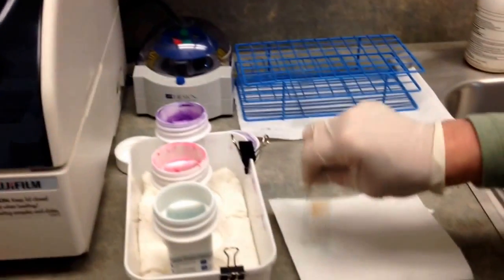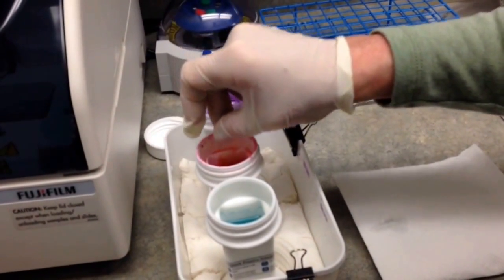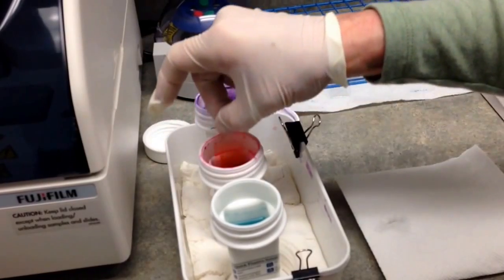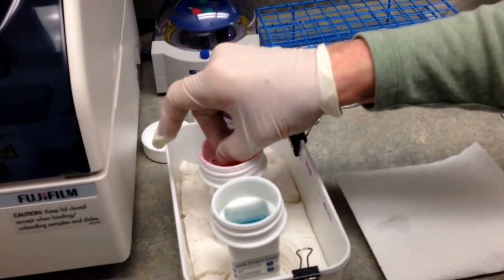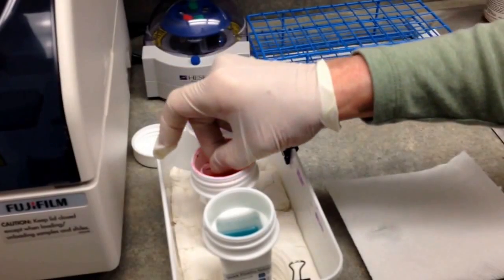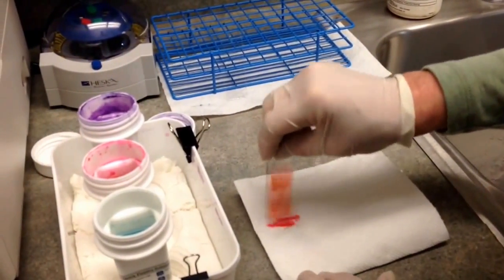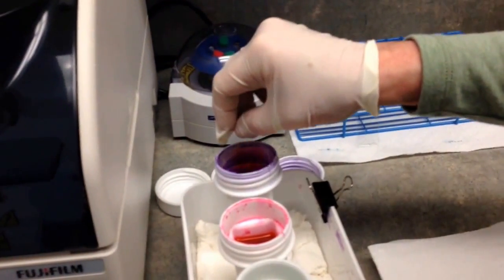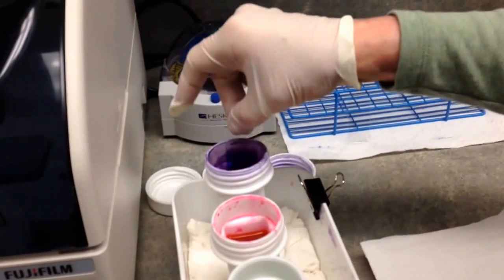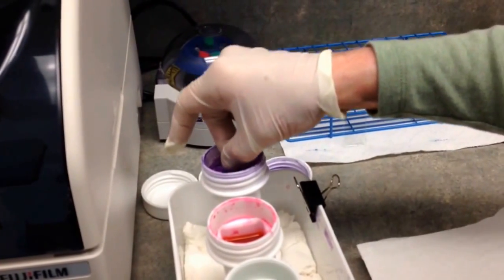Tap it on a paper towel to absorb the liquid, then go to the second part, which is a stain. Hospitals use varying amounts of dips depending on the hospital — it's fine if yours uses more or less; this just works well for me. Blot it, then go to the third stain. Again, eight dips, and blot it again.